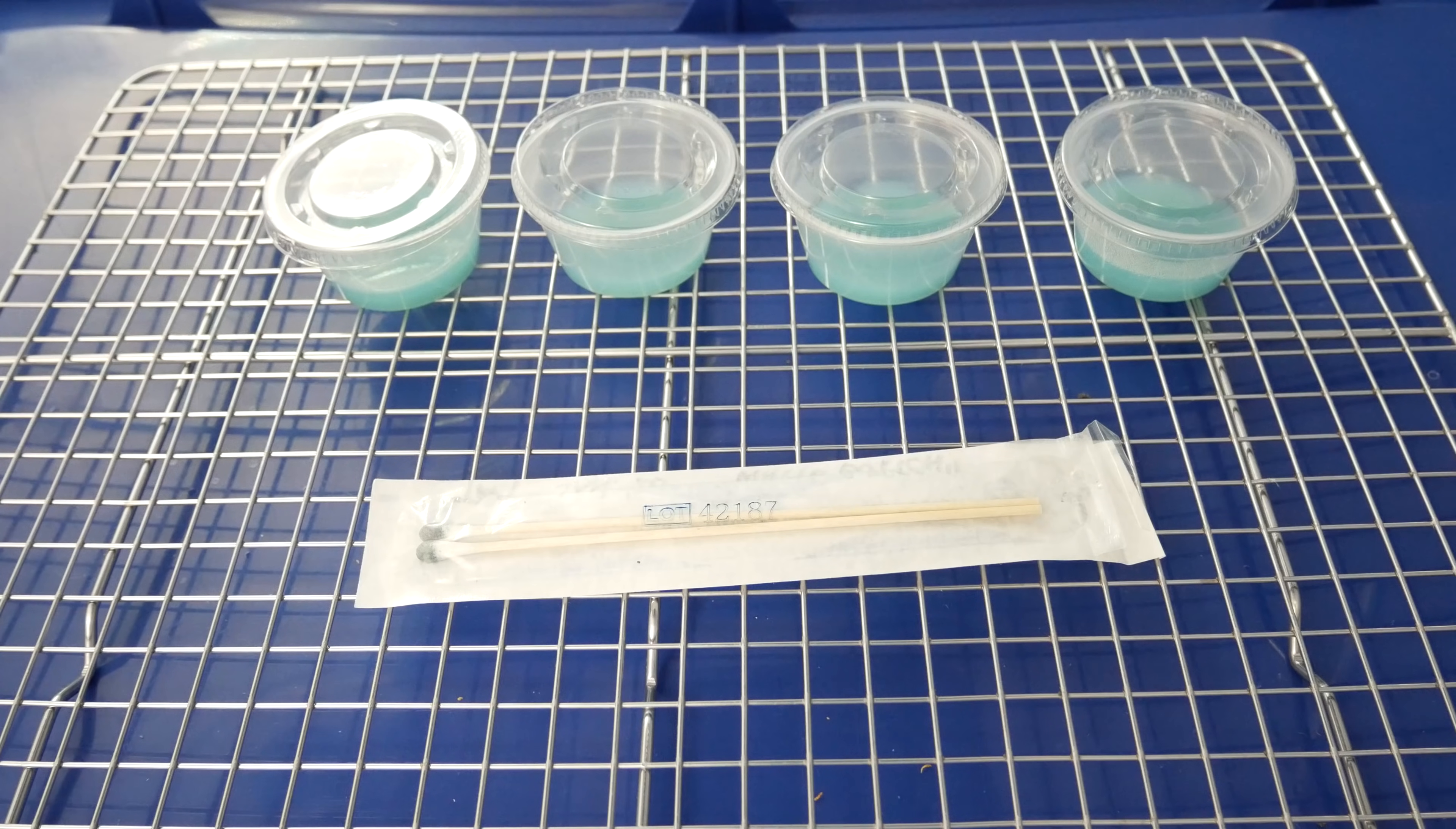What's up students, welcome back to class, it's PGT Sensei. We're back in the still airbox again. Today's class we're going to be going over spore swabs to agar, so let me show you how easy it is to work with spore swabs.